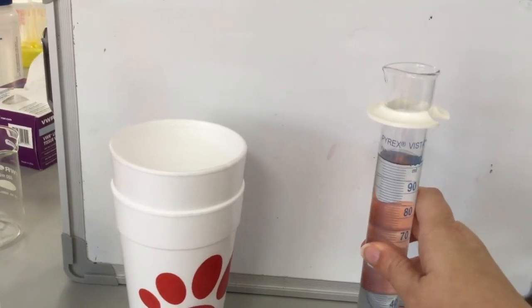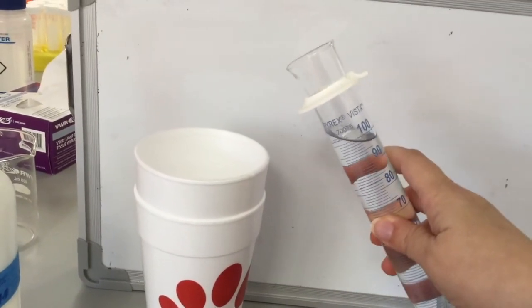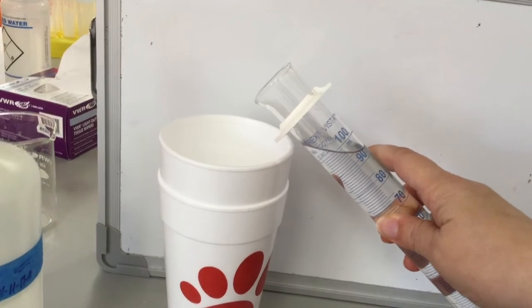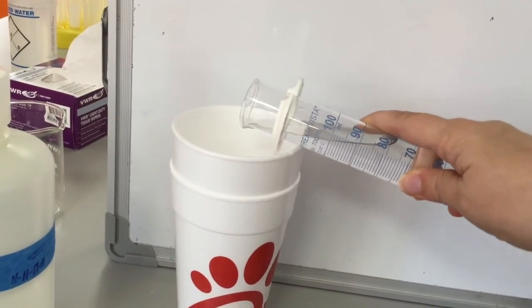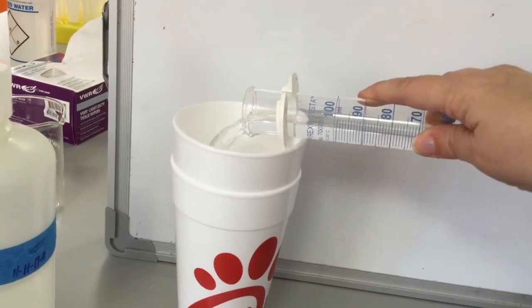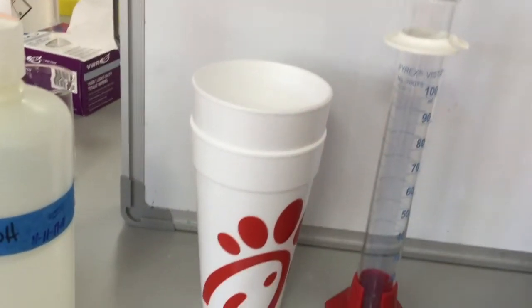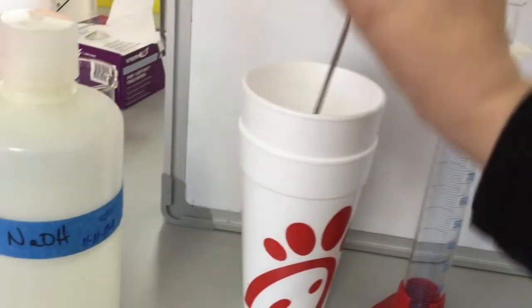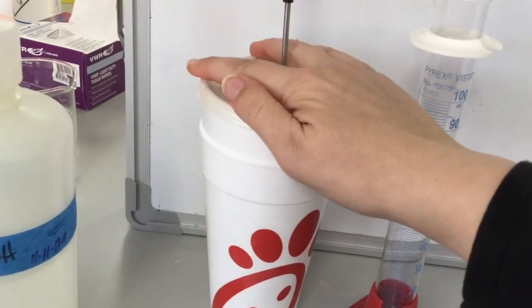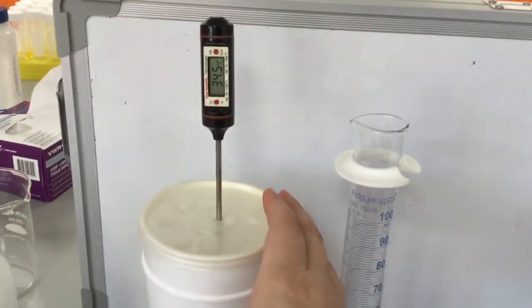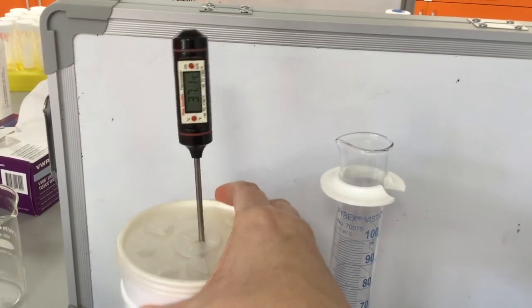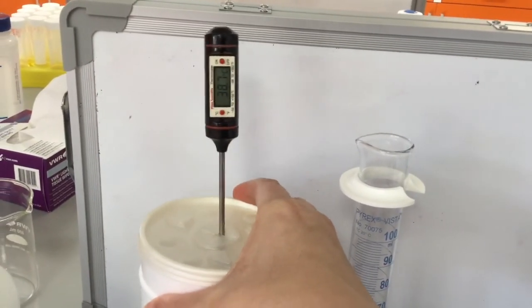As with the first part of the lab, we're going to pour in the sodium hydroxide and then immediately add the lid and the thermometer so that we can see the temperature changes from the beginning. Continue to watch the thermometer until the temperature either levels off or has reached a peak and has started to drift downward.